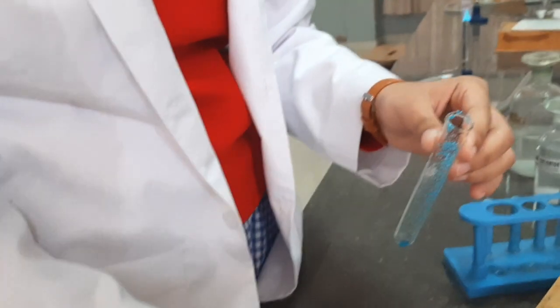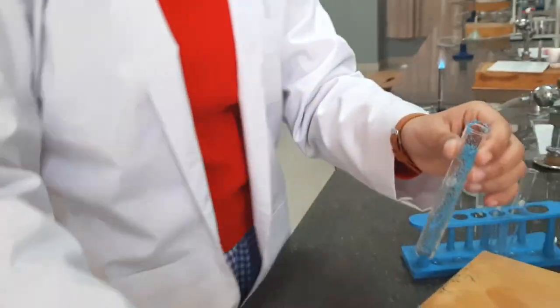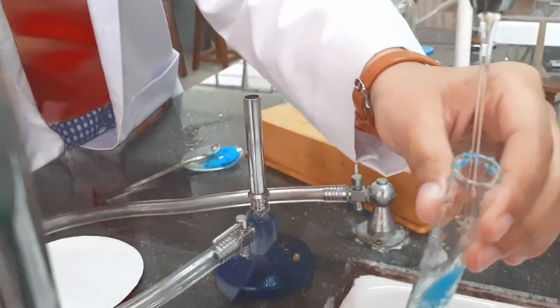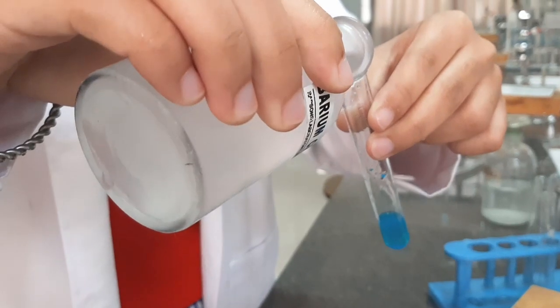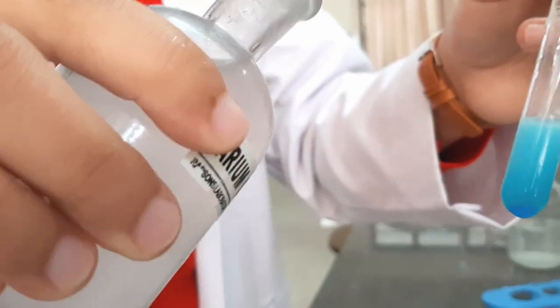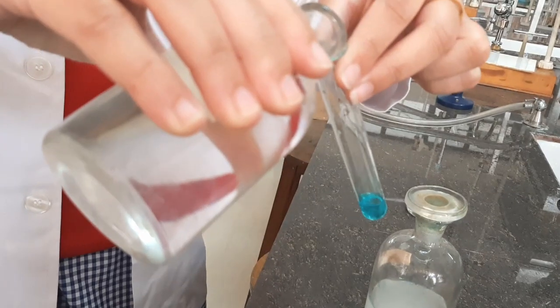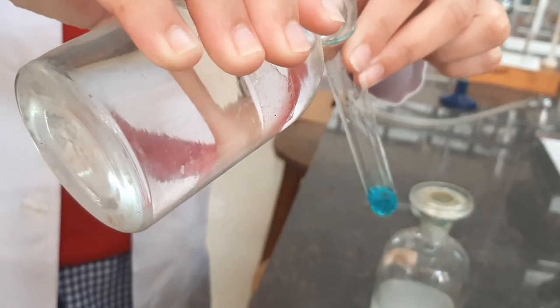We will proceed now for independent testing of radicals — we will go for testing of sulfate ions. Make the aqueous solution. To the aqueous copper sulfate solution we are adding barium chloride, and a white precipitate or milkiness shows presence and confirmation of sulfate ion.